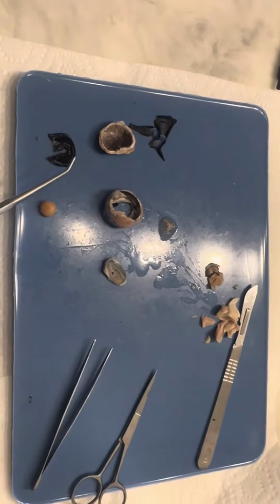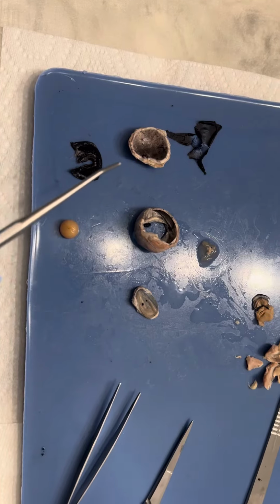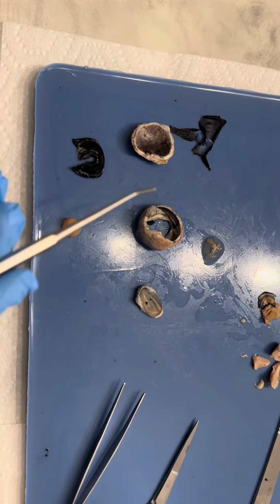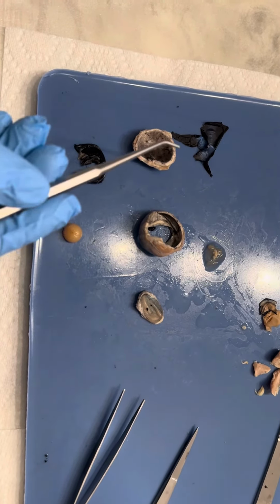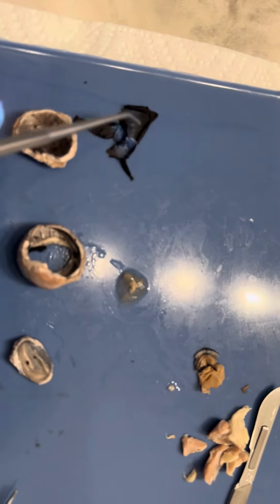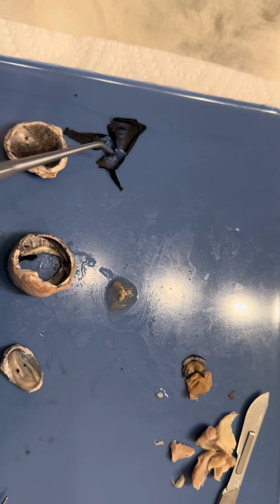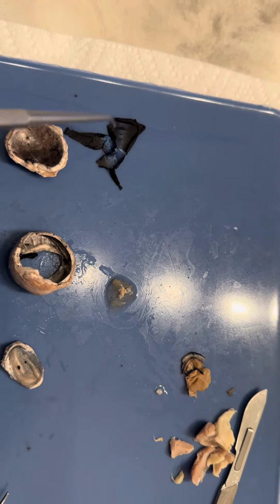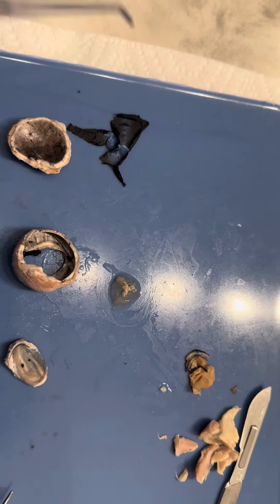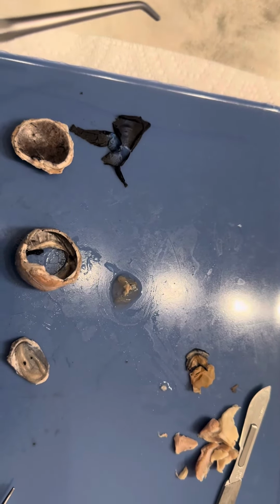So inside the eye, it appears black. This is actually the choroid layer. So this layer helps absorb light rays. In animals, there's another layer on top of this. It's a reflective layer called the tapetum lucidum. It's this bluish kind of metallic color. So this layer isn't found in humans, but in animals, it helps assist in night vision by reflecting light back onto the retina.